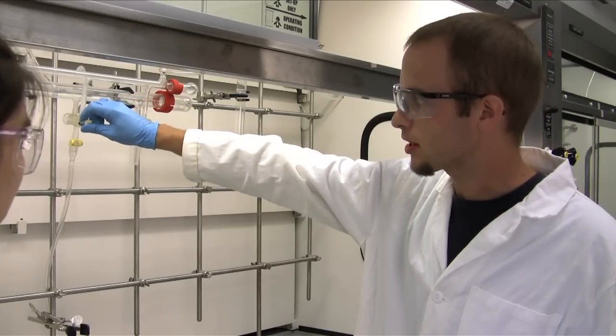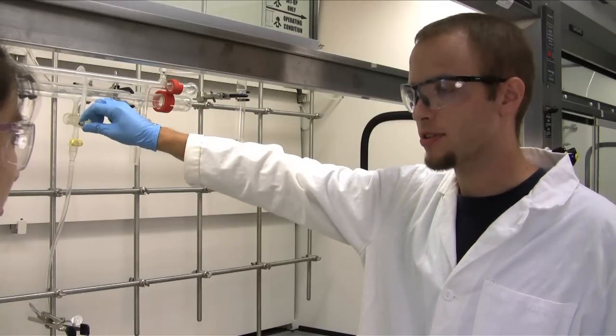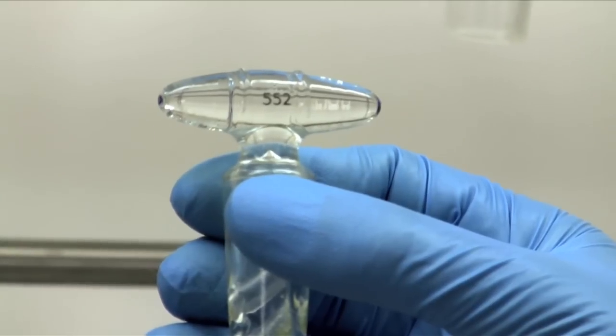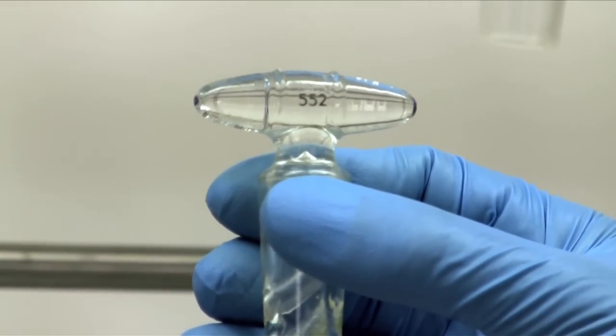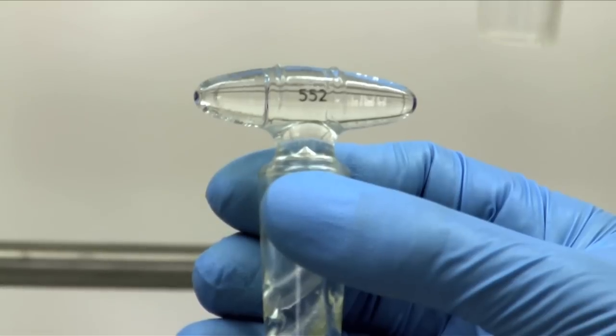Looks like this valve is stuck. Let's take the valves out, clean them with hexane, and re-grease them. Although these valves look the same, they're unique. See, each one has a number that will allow you to put them in the right place.